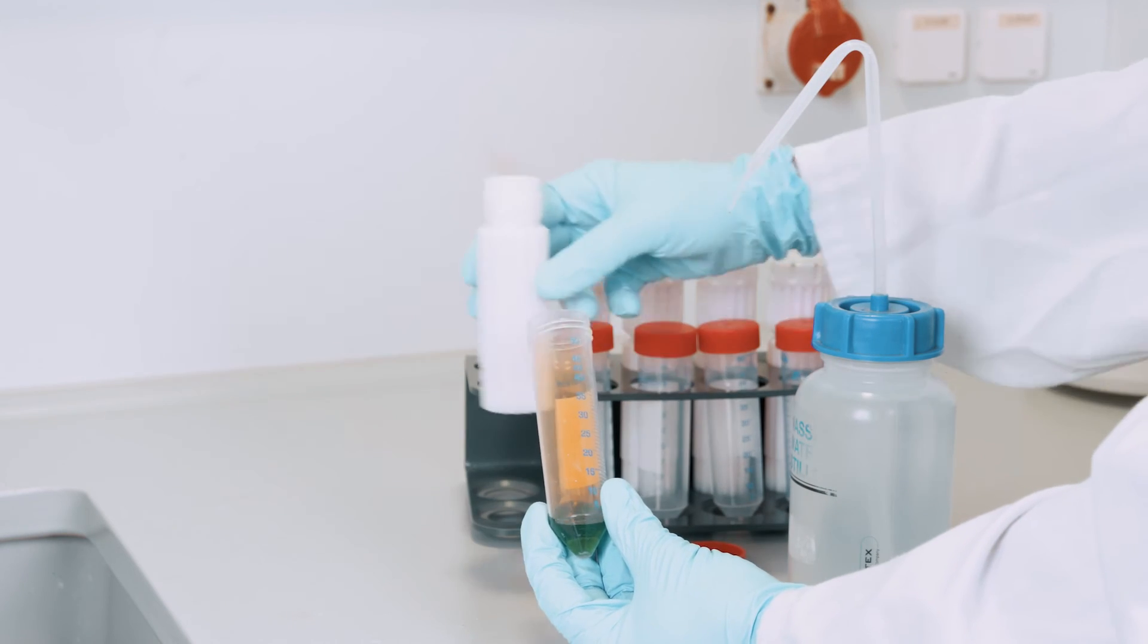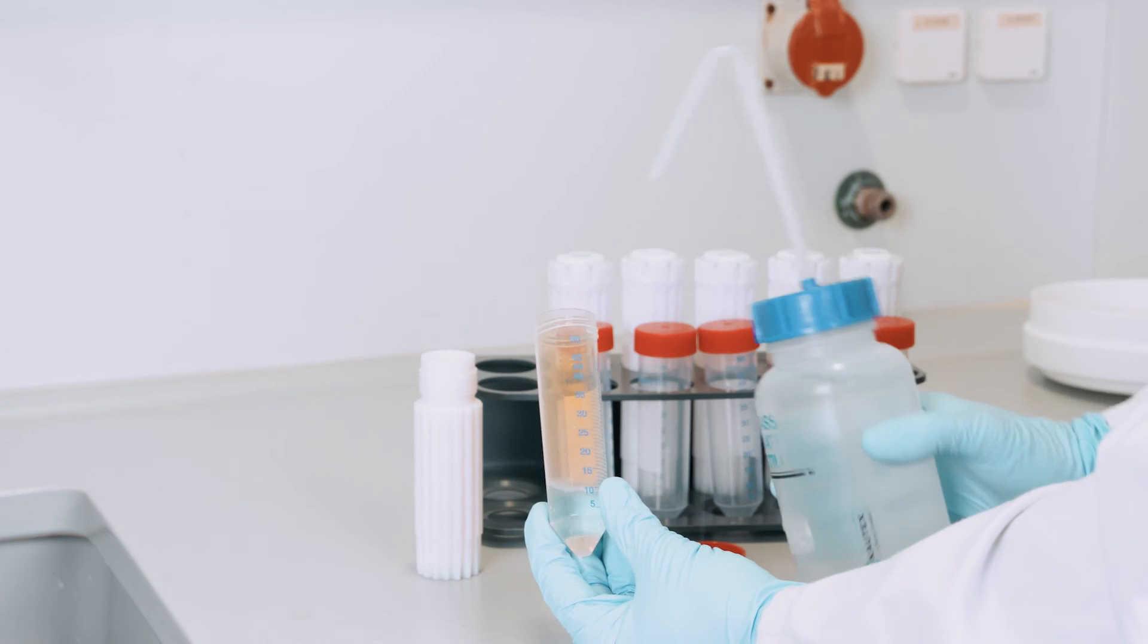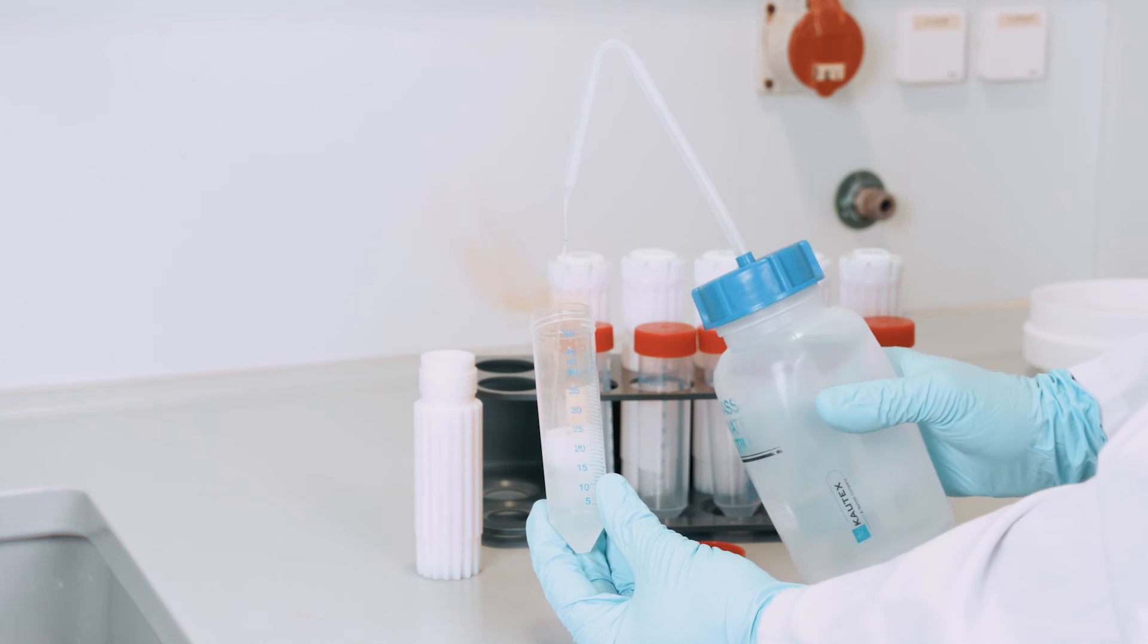We add water. If the solution stays clear, then the digestion process has been successful.